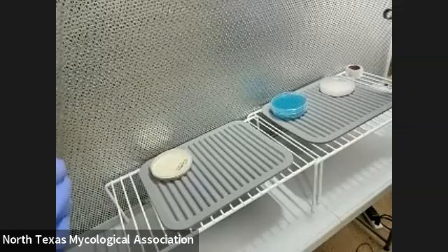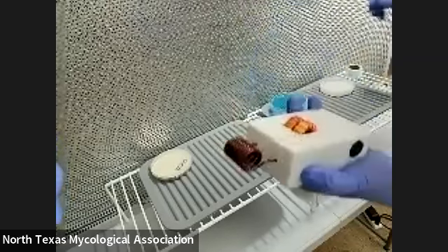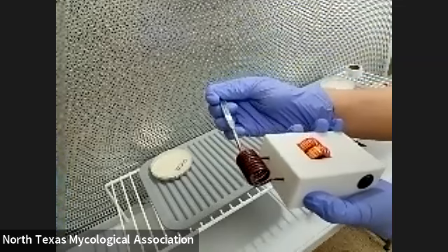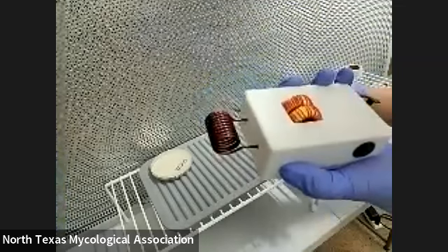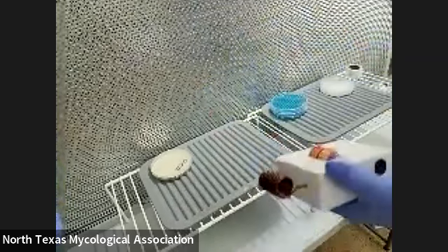I have this fancy little coil — is it an induction coil? It's going to heat up when you put your scalpel through it and sterilize it through some weird science. It's going to heat up the scalpel and make it sterile. I'm going to bring this as well. We can have two stations so it takes less time for like 20 people to go through the lab.